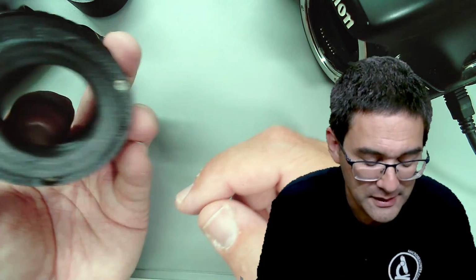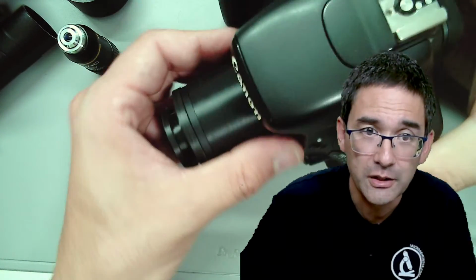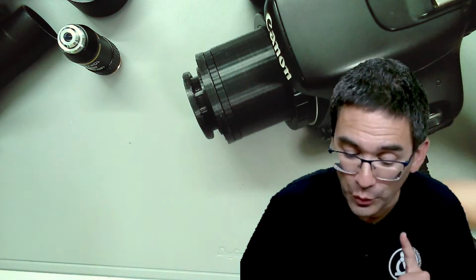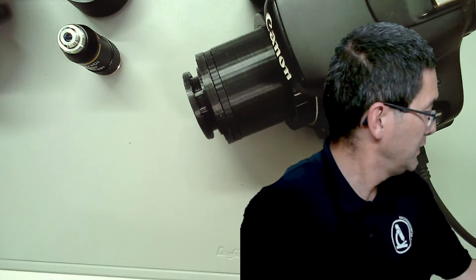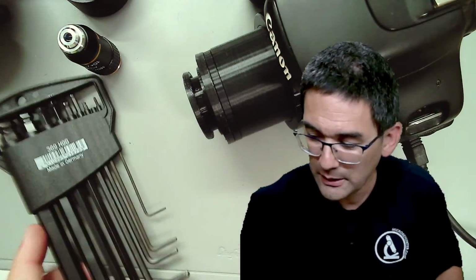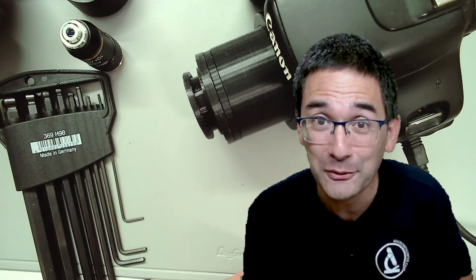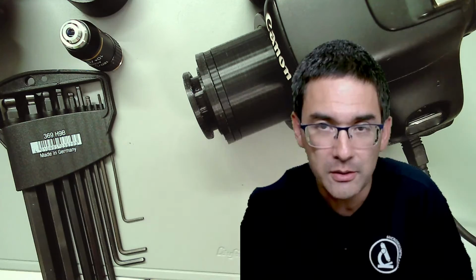And I 3D printed this, and basically I put this then on top of the microscope. So it goes in here. And this goes on top of the microscope. I'm going to show this to you. Where are my little tools? In a second. Maybe you can, if your microscope allows this, I'm not saying that you should 3D print it, because many people don't have a 3D printer, but maybe there are different alternative solutions using strong cardboard, or maybe some people are able to CNC something, okay?